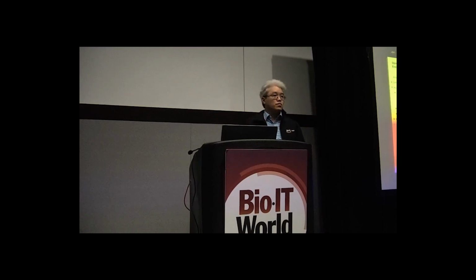Suppose I have my pipeline, which we developed in the lab. Will your system allow me to run it on your platform? If you have a pipeline that is already developed, getting a little ahead of the game, but if it is written in, say, WDL or Nextflow, you can bring that workflow definition into Omics workflows and run it there.